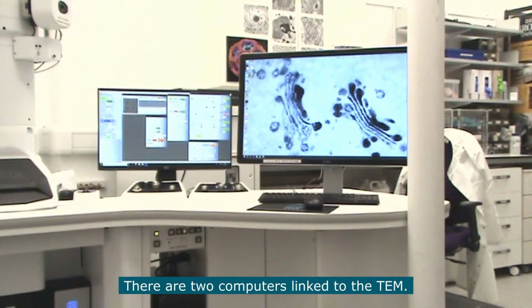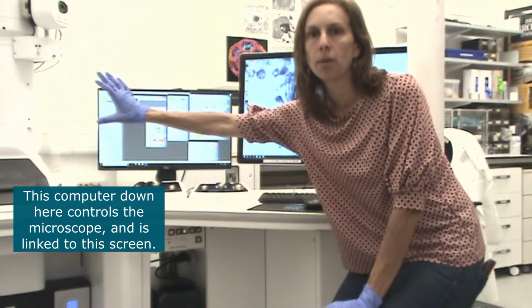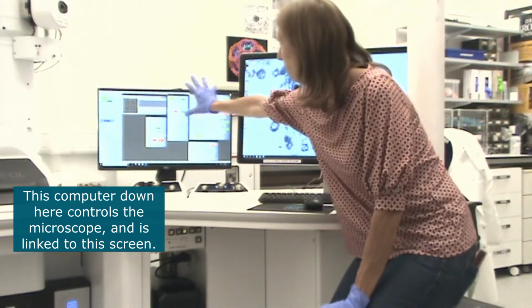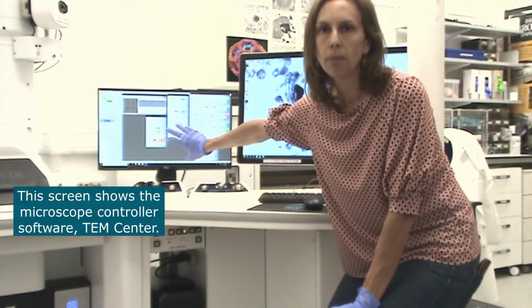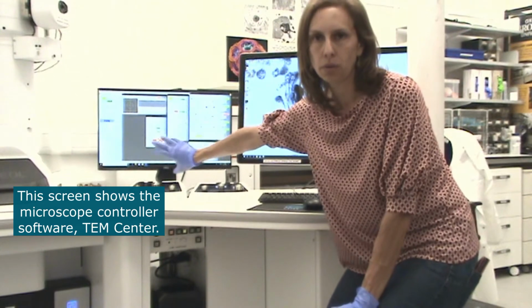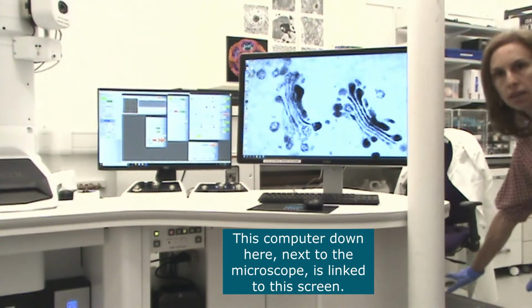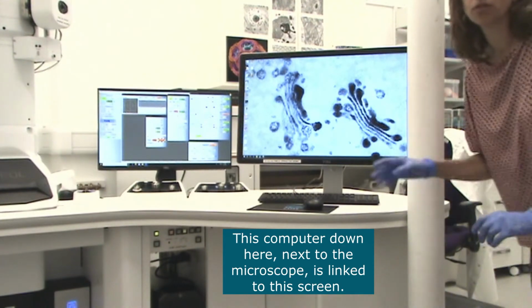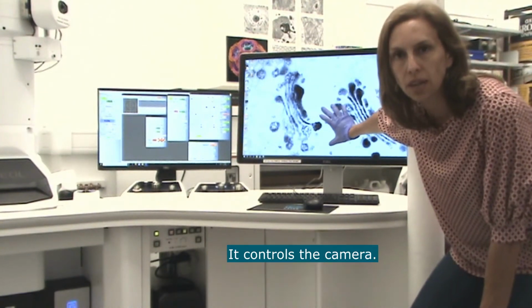There are two computers linked to the TEM. This computer down here controls the microscope and is linked to this screen. This screen shows the microscope controller software, TEM Center. This computer down here, next to the microscope, is linked to this screen. It controls the camera.